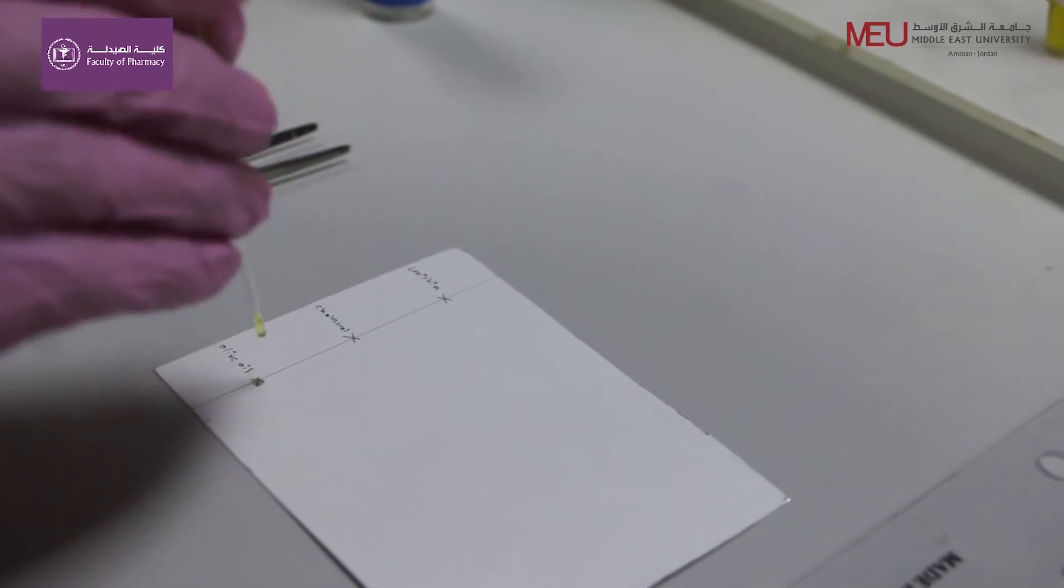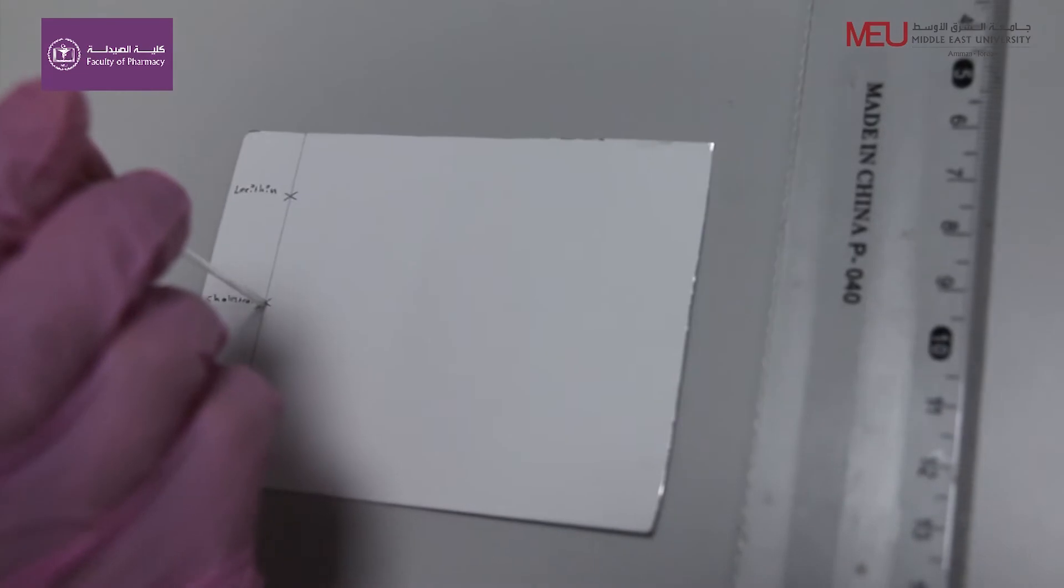Spot gently and quickly into the marked positions. Small spots are required for good TLC results.